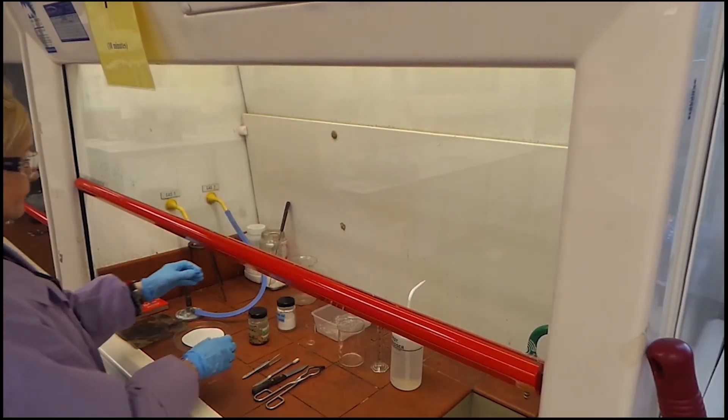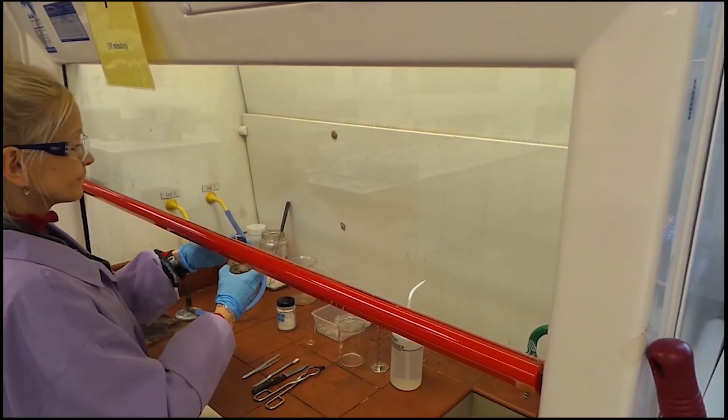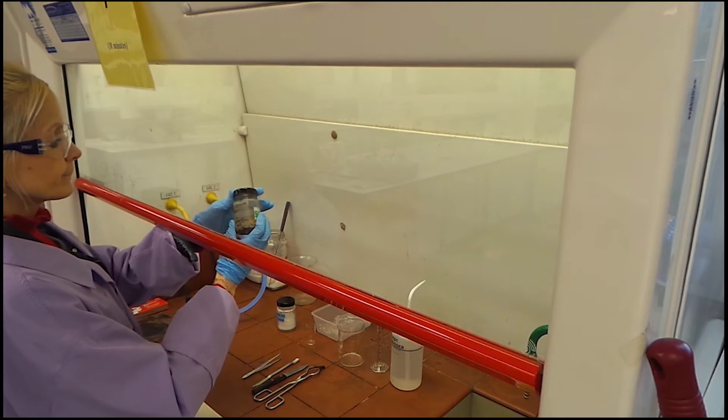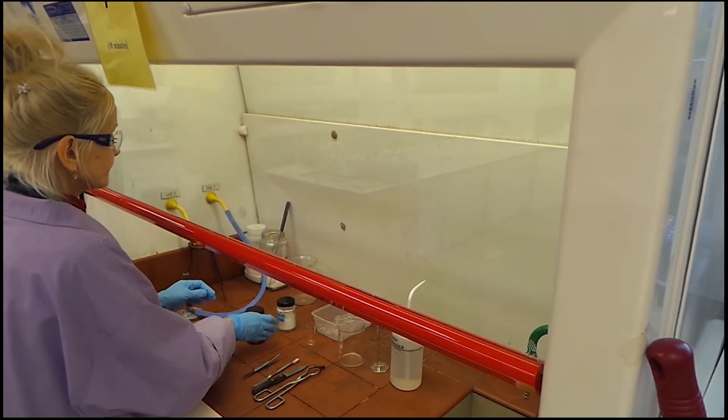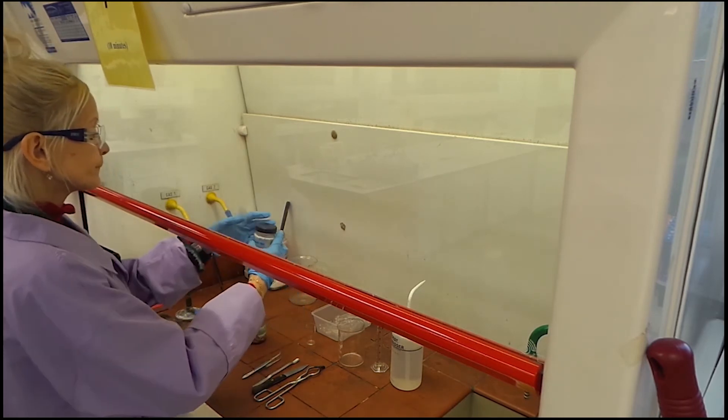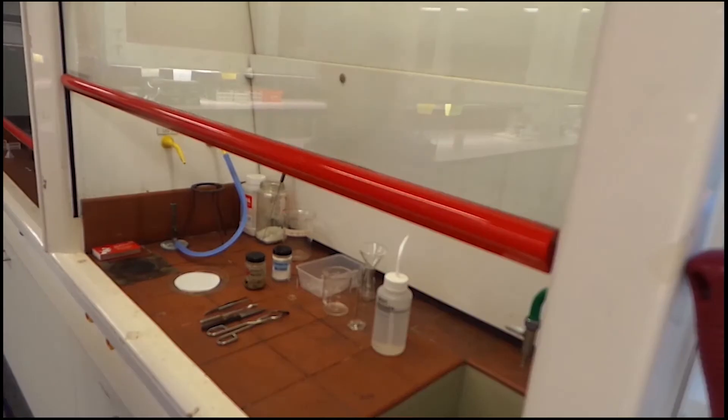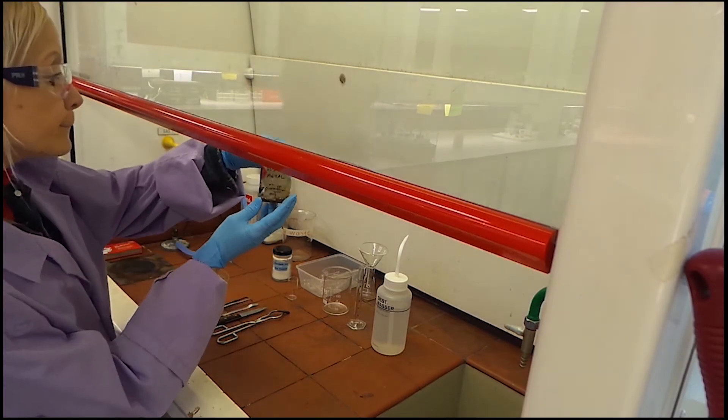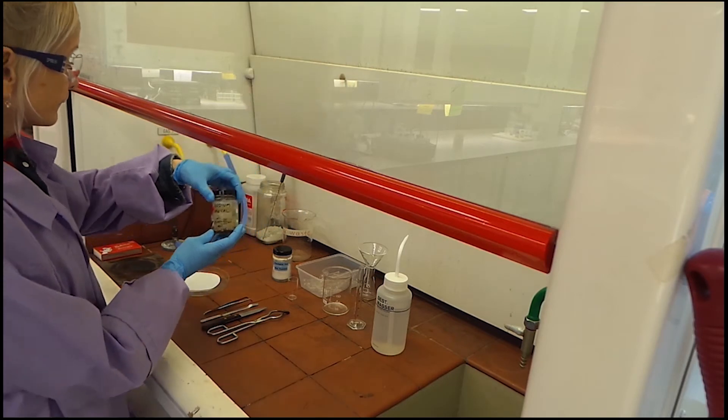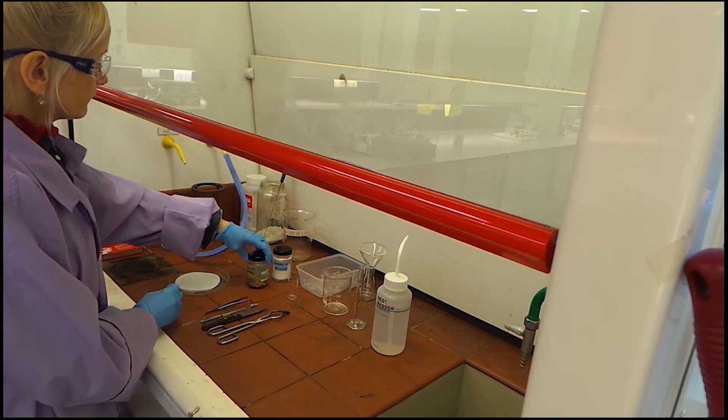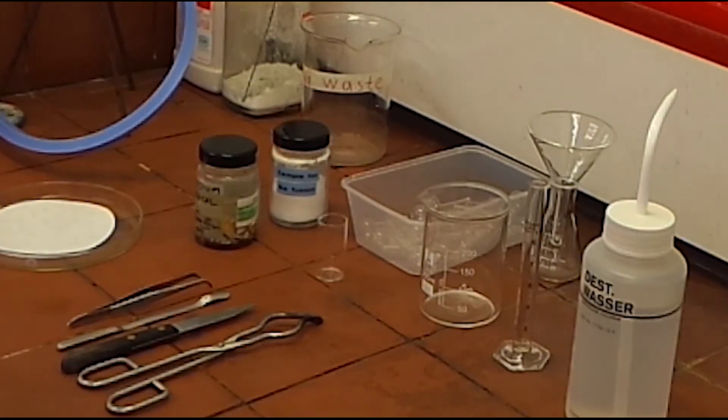As sodium metal may catch fire, we will perform this test in a fume hood. We are going to use the solid unknown and sodium metal. We store the sodium under liquid paraffin in an air-tight container to prevent contact with air and water.